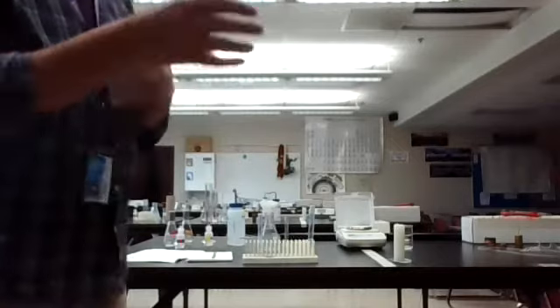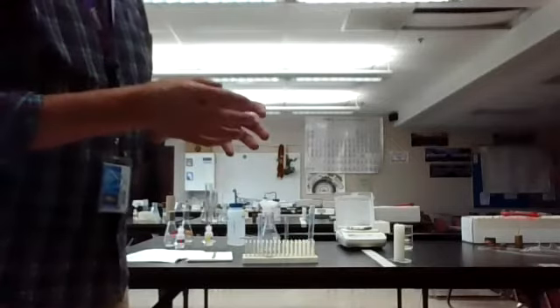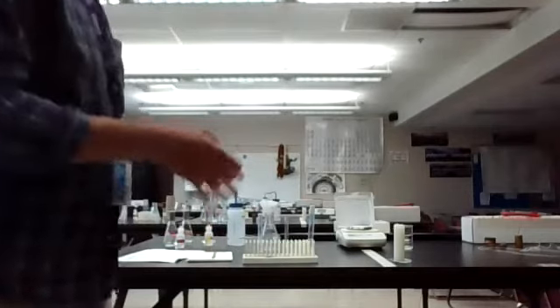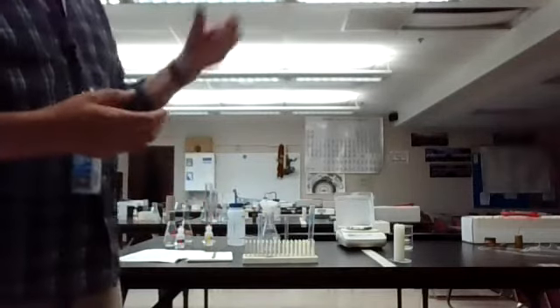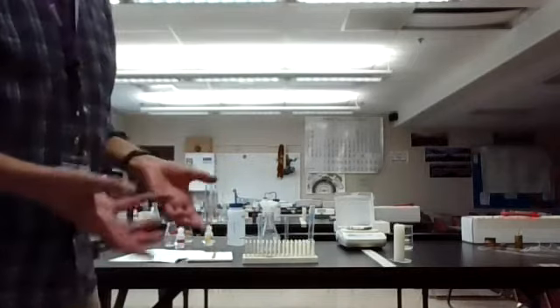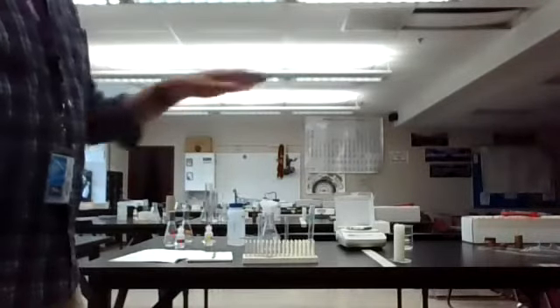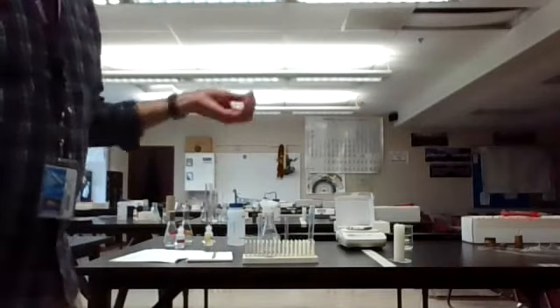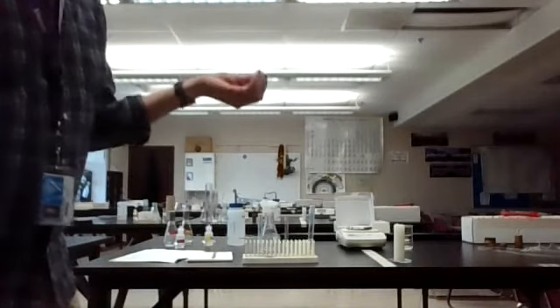Physical change, generally speaking, the atoms stay in their same arrangement and can be put back quite easily. When we have a chemical change, though, you actually remove some atoms and put them with something else and change the physical nature of the substance. We no longer have the original wick that we had. Some of the wax burned off. We can't collect that back.